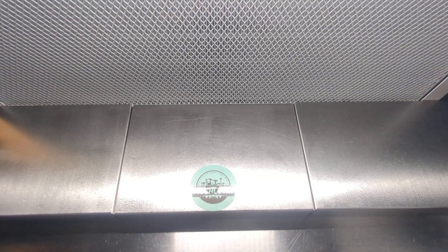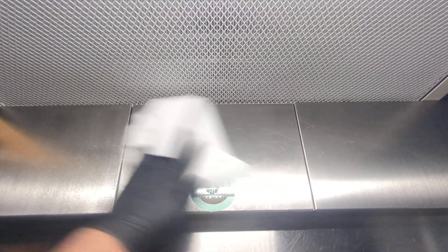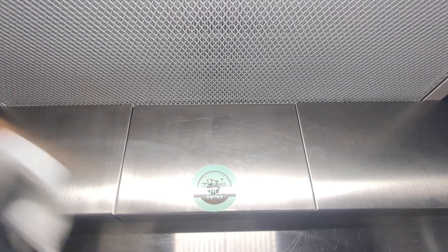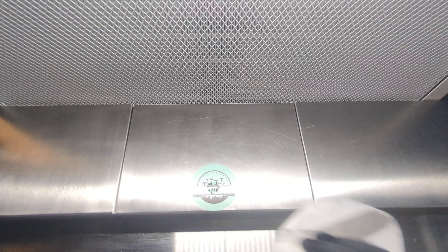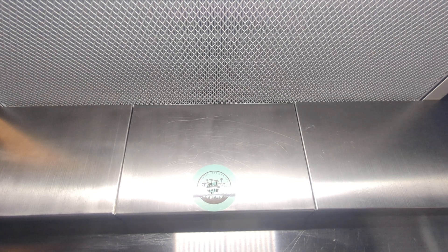I'm going to start by cleaning down the surface here with some 70% isopropyl alcohol on a basic paper towel, just going to wipe everything down. I've also had my flow hood running for 30 minutes as well, which kind of cleans out the room itself, so we should have pretty good luck today.